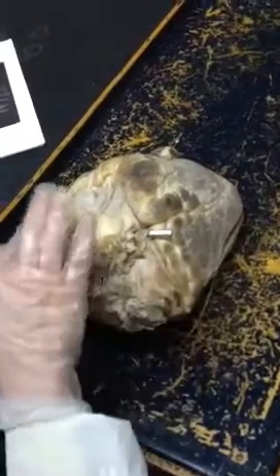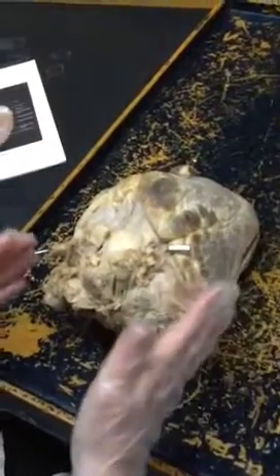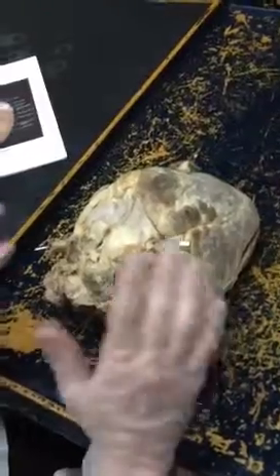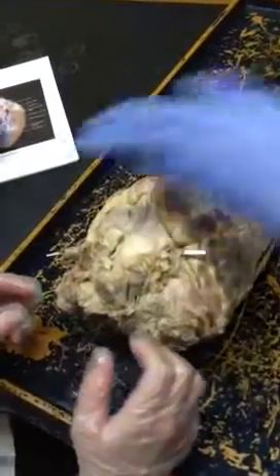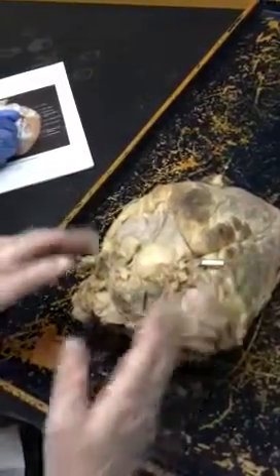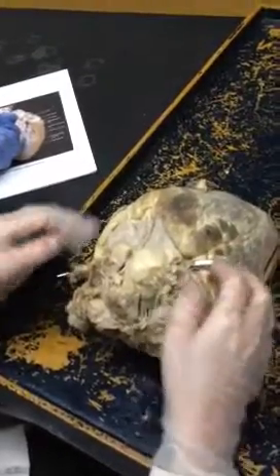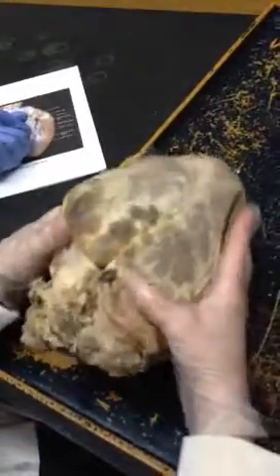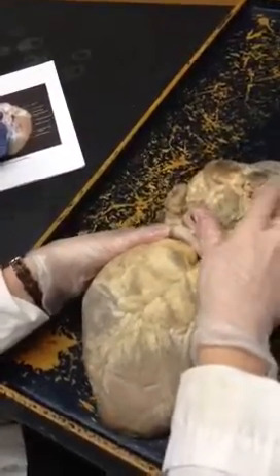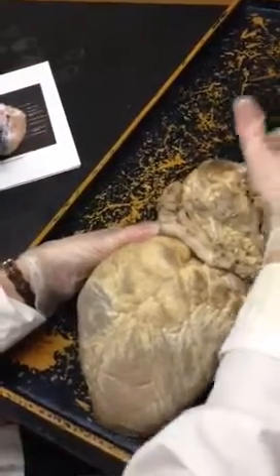This side might not be visible — it might just be half of a heart, so don't depend on trying to see something over here. If it's a rod going through connecting them, then you know what it is. Don't depend on that. If it's half a heart, inferior is down and superior is up that way.